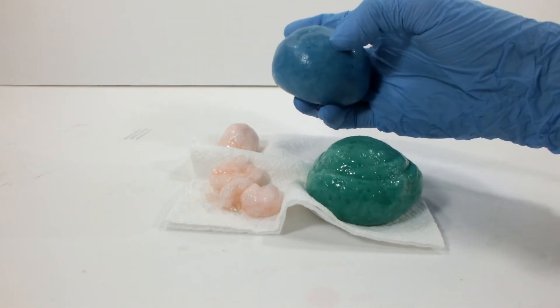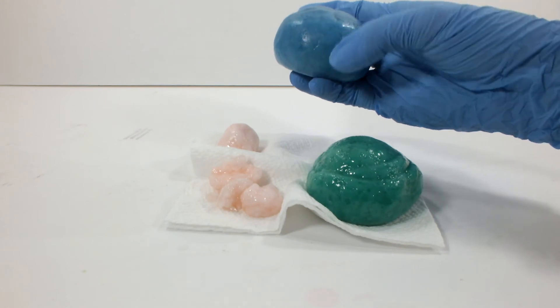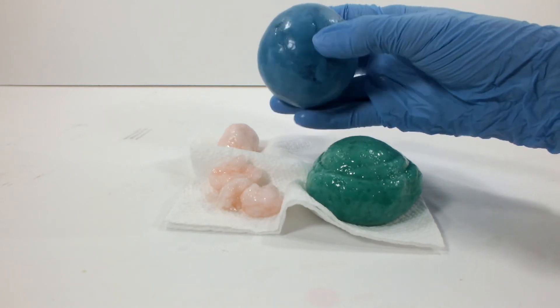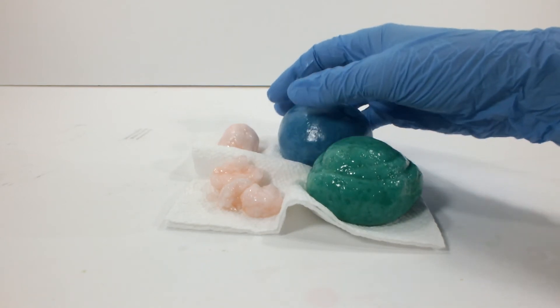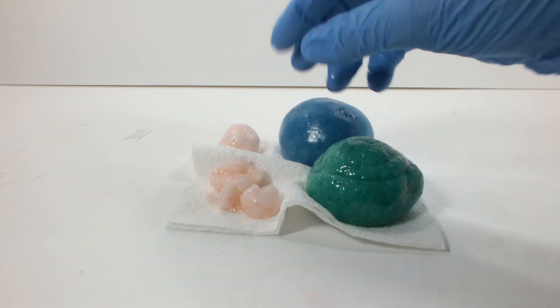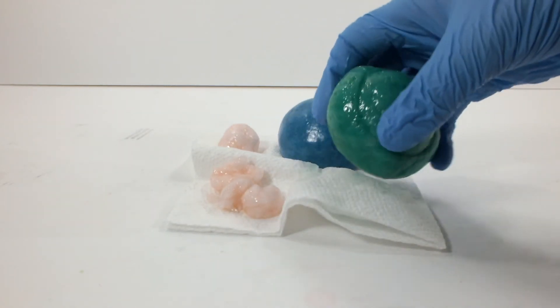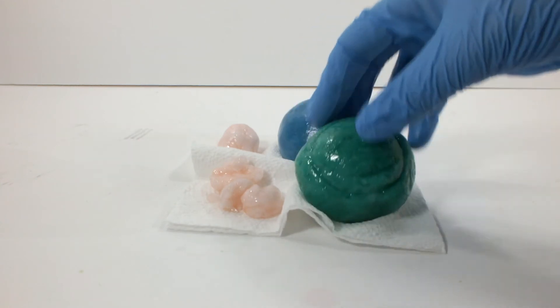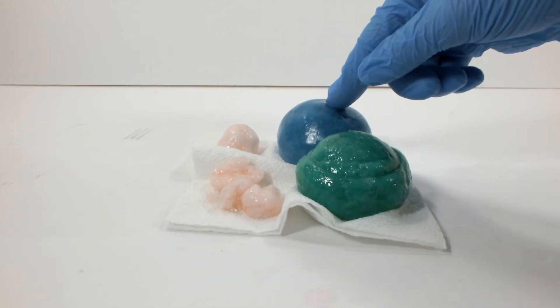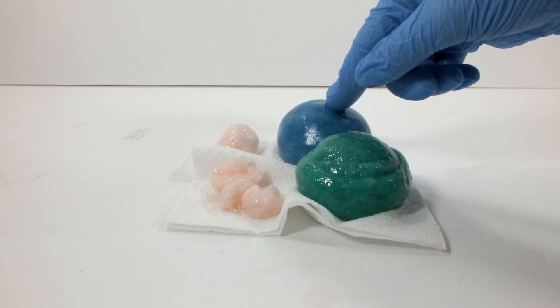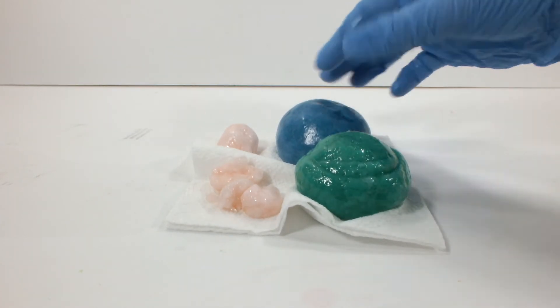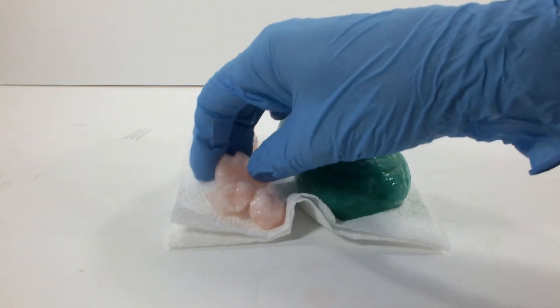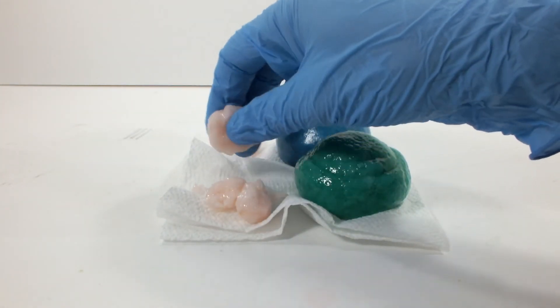That wasn't as bad as it sounds. All the liquid was on the other side, so it didn't make a mess or anything. This one was good. And both of these that were made with straight up alcohol and straight up sodium silicate, without the additional water, much better. Dense. These are much better than with the additional water. This is still very wet, and this is actually a lot stickier, even though these are pretty sticky. This one especially.